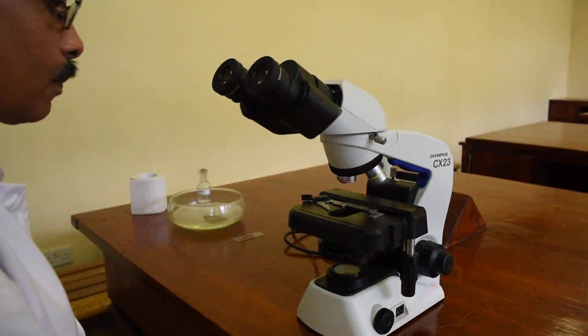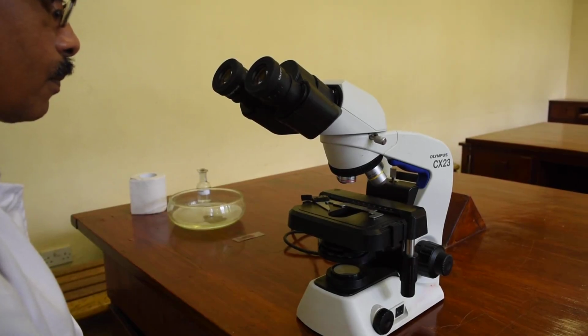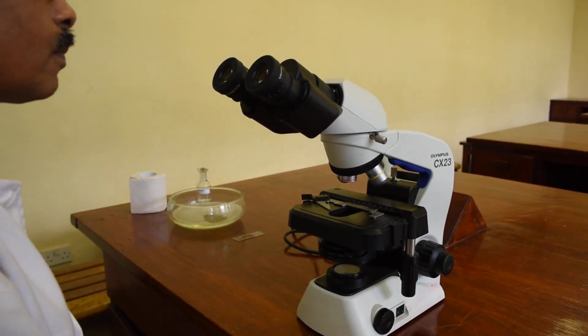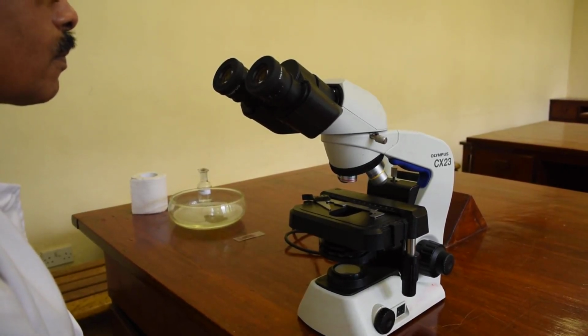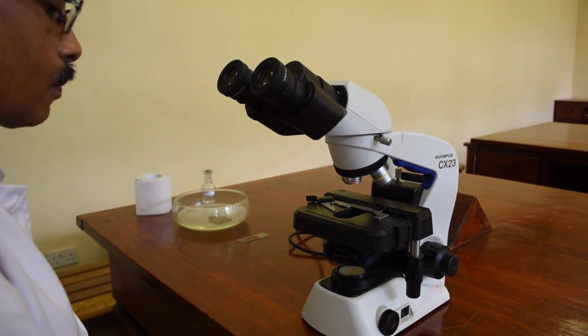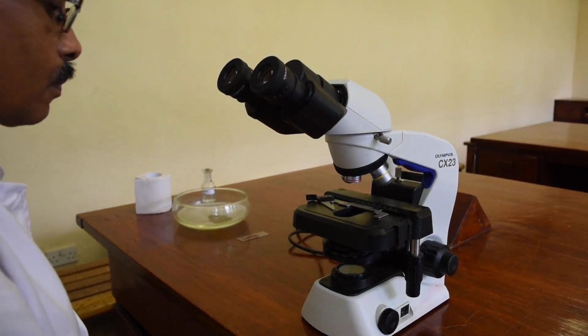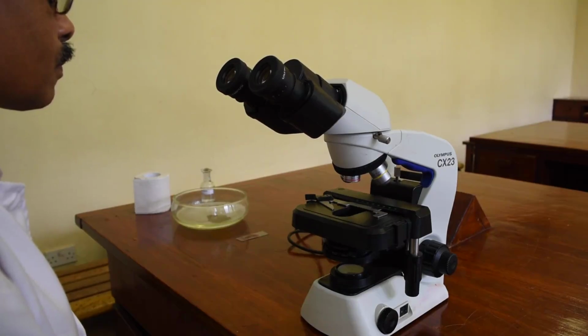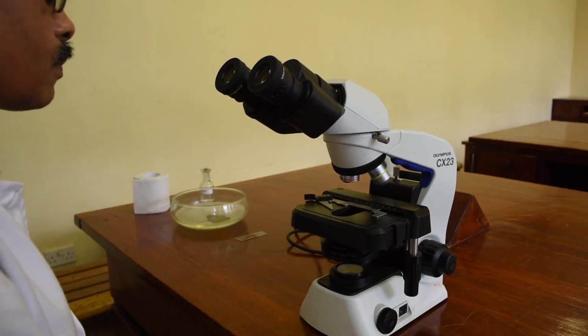Hello, today we are going to demonstrate how to use a microscope for you. So this will be your first practical experience in the microbiology laboratory. Just to introduce the microscope for you, I'm sure you would have learned the parts of the microscope previously. But just to recap your knowledge from the histopathology, we will be doing the parts of the microscope today.